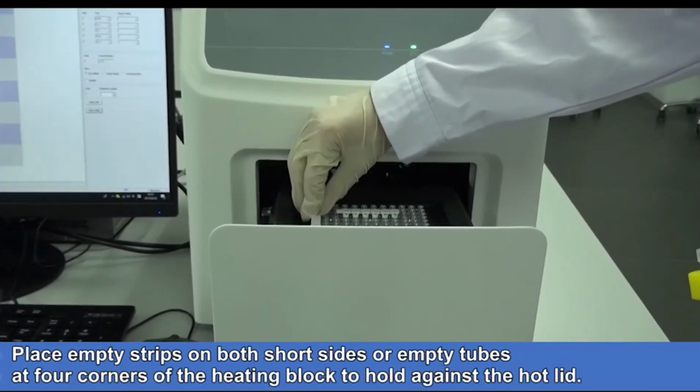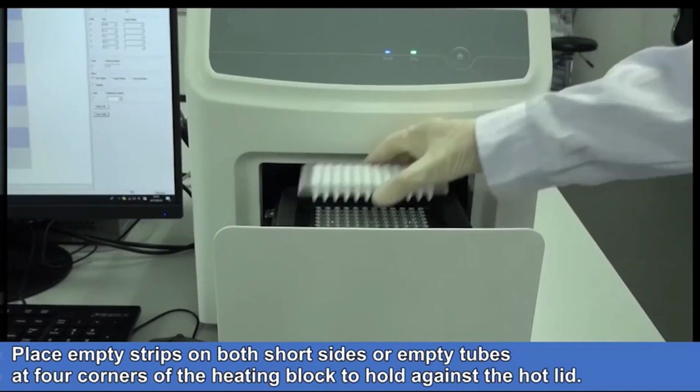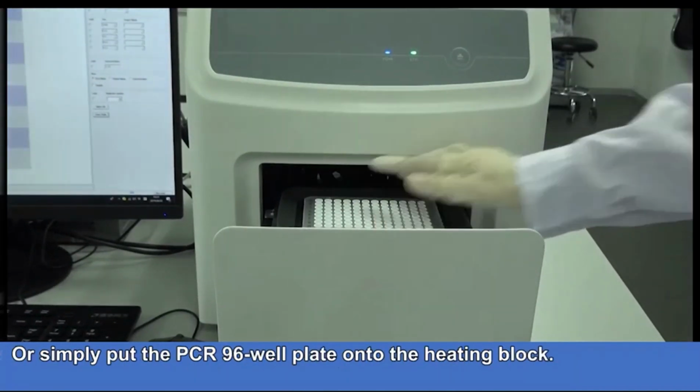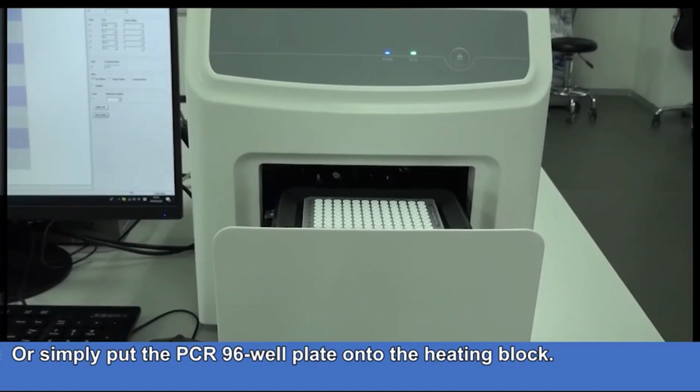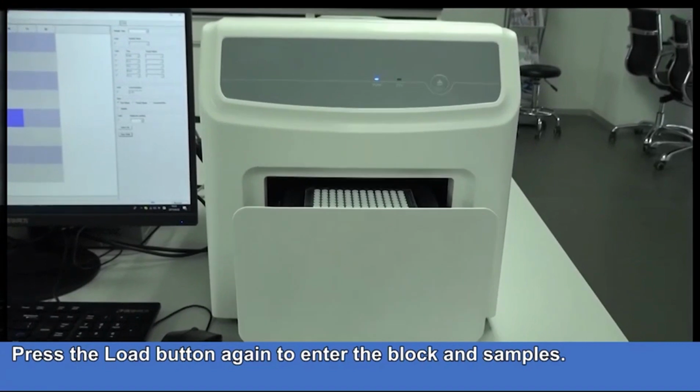place empty strips on both short sides or empty tubes at 4 corners of the heating block to hold against the hot lid. Or simply put the PCR-96 well plate onto the heating block. Press the load button again to enter the block and samples.